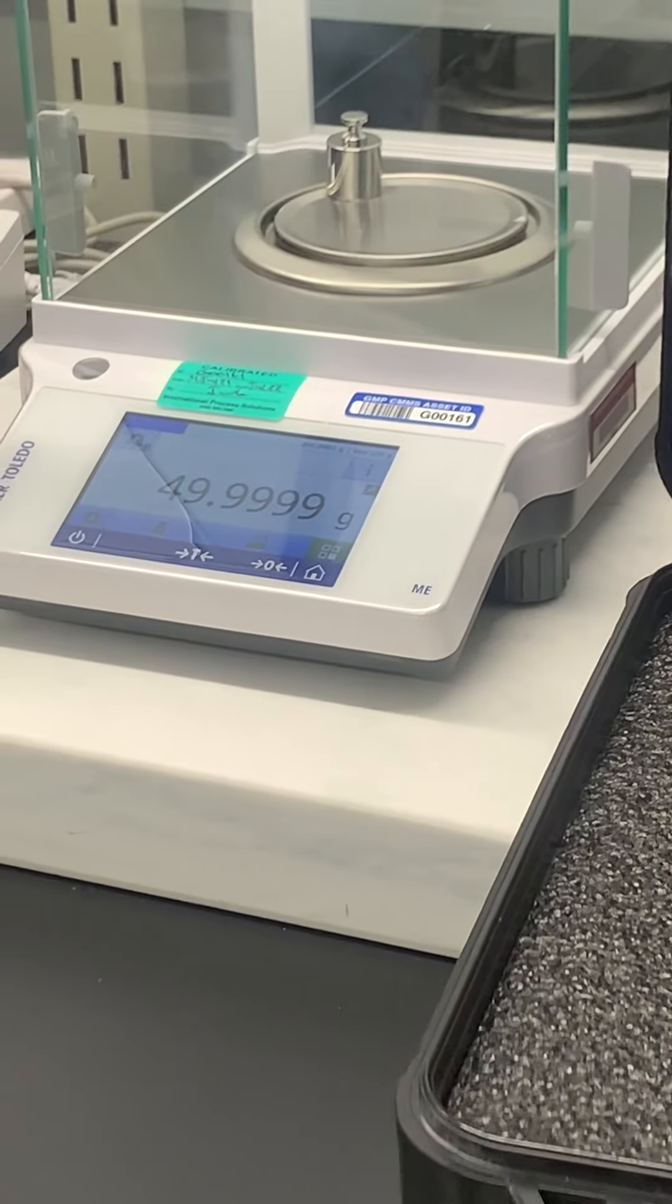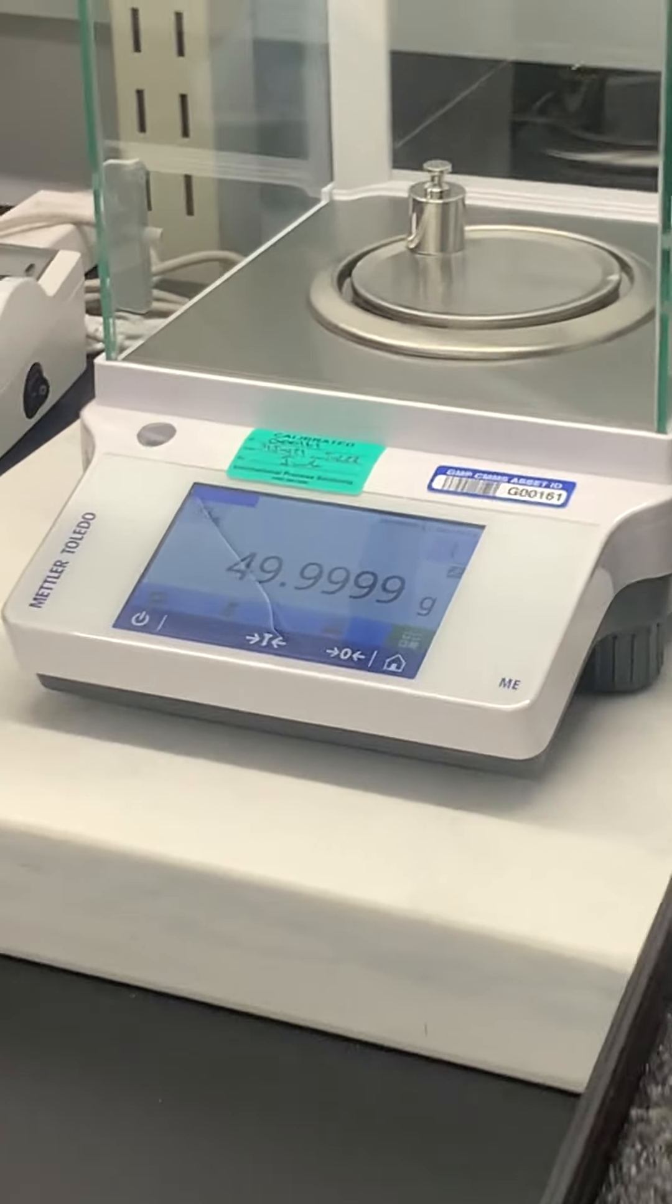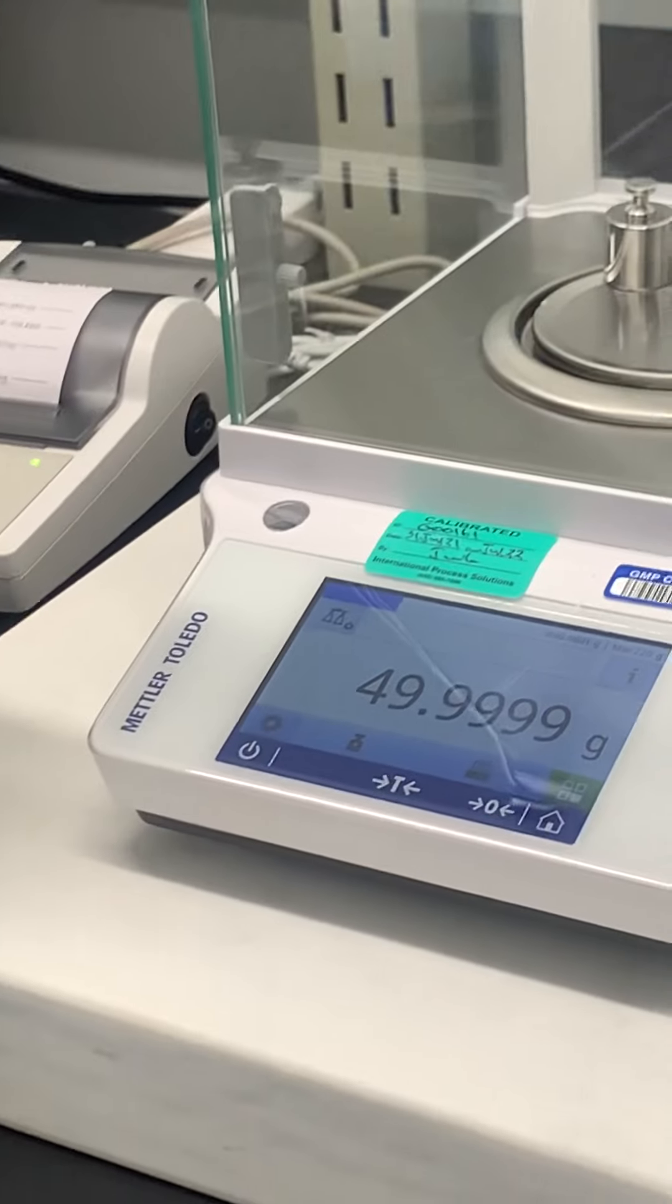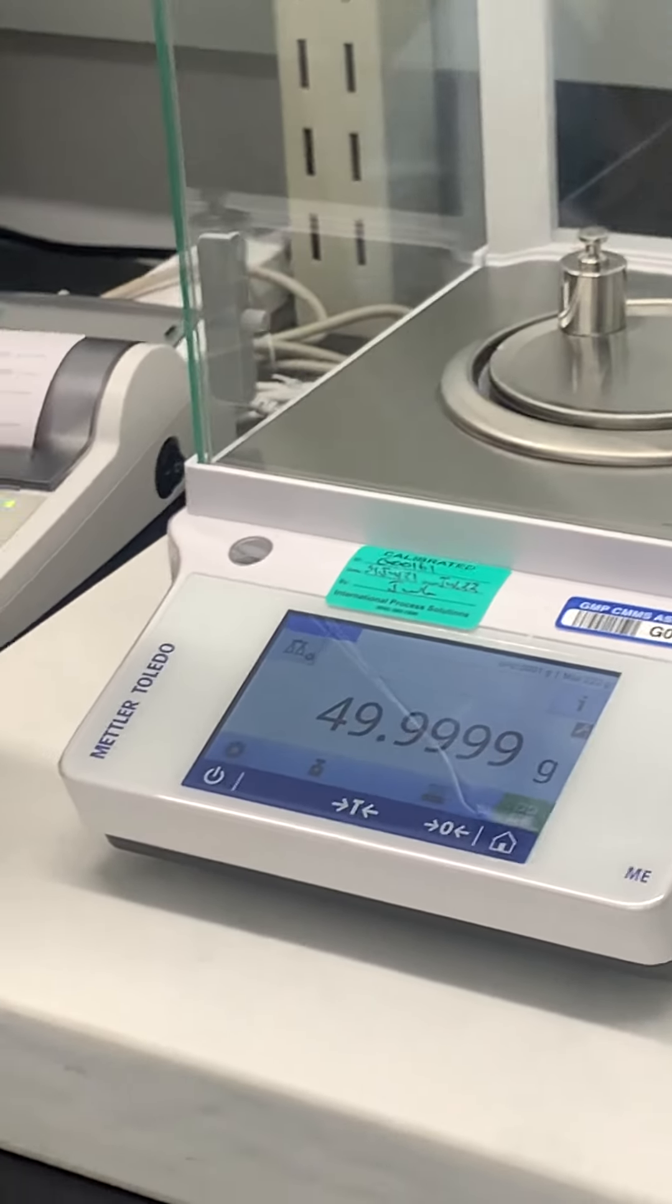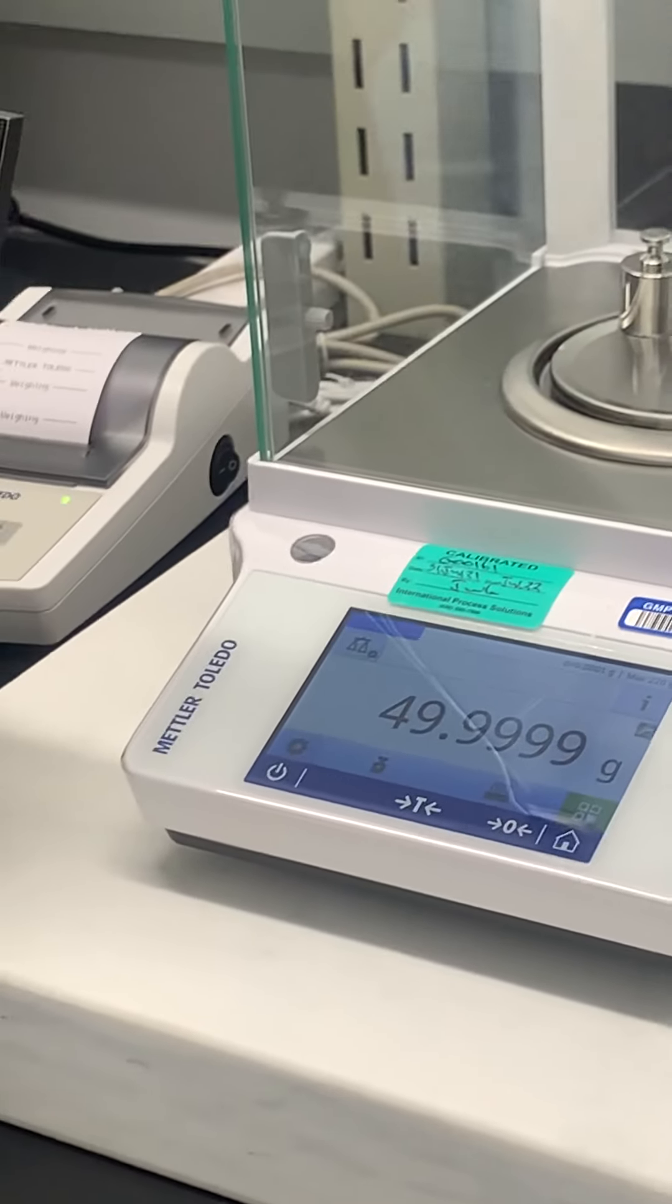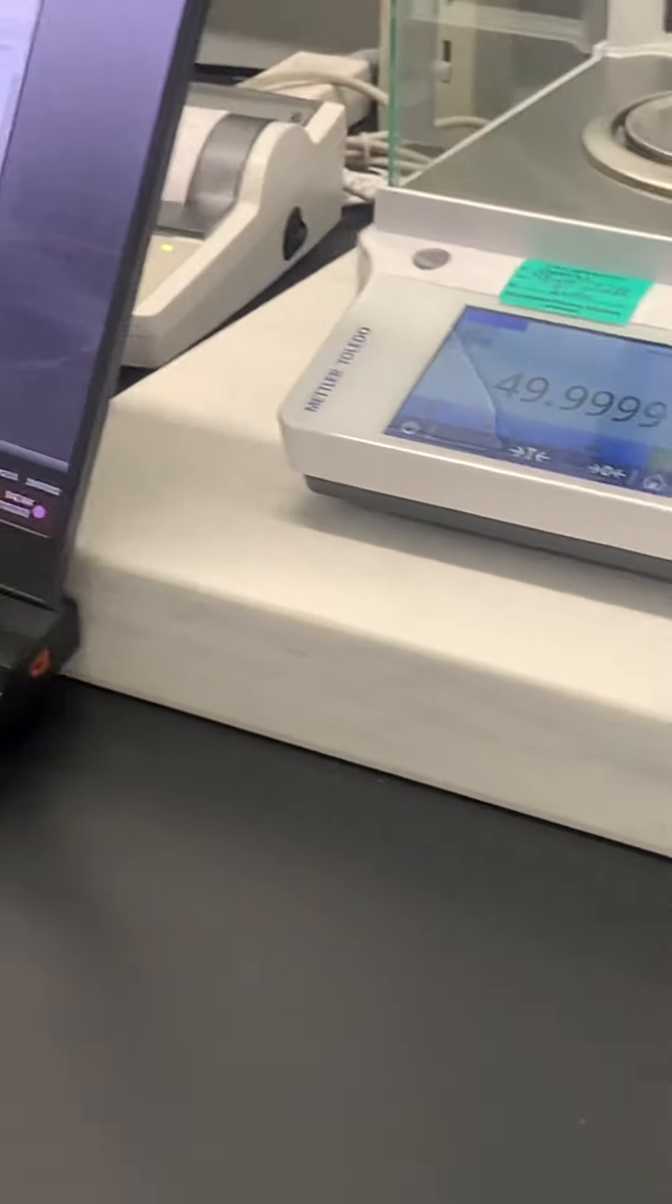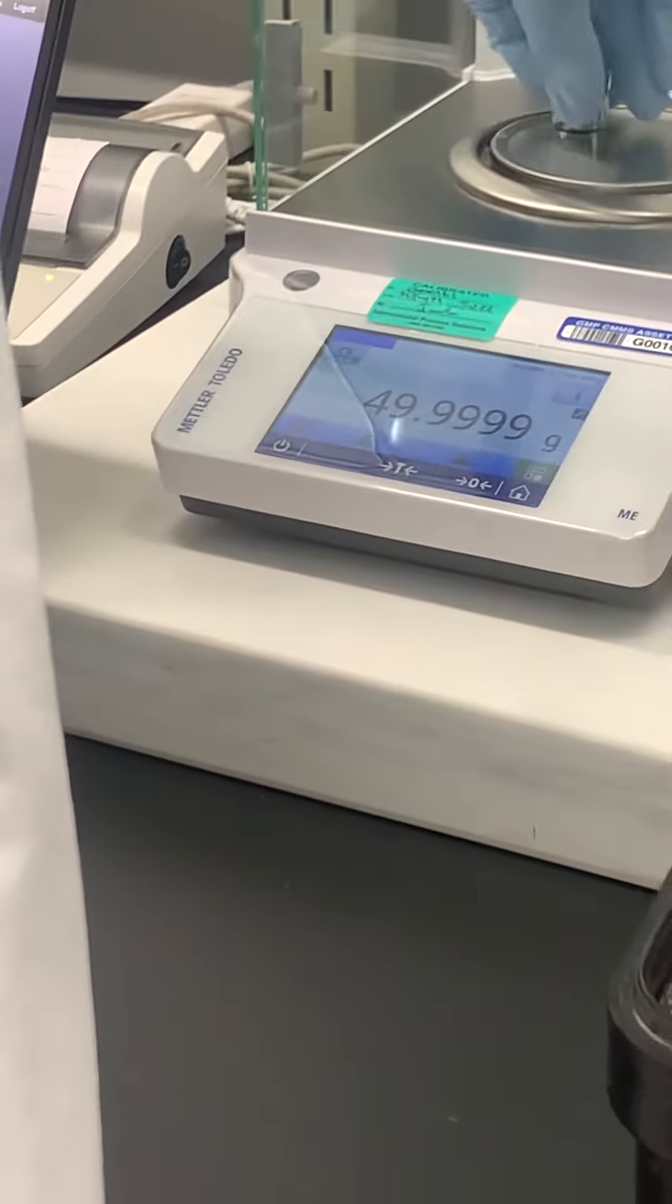Oh I like that even better. So if it wasn't passing and you put that in, would it turn red or something? Yes, okay. So let's say... gotcha, okay. It's not gonna like it if it's out, sometimes though.